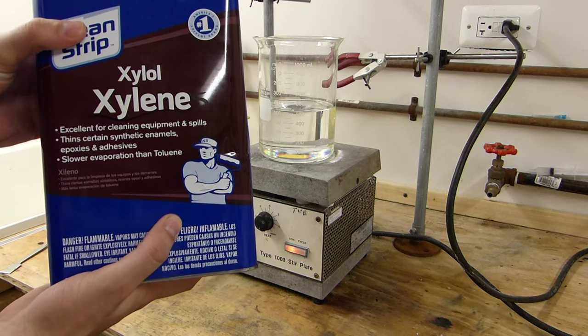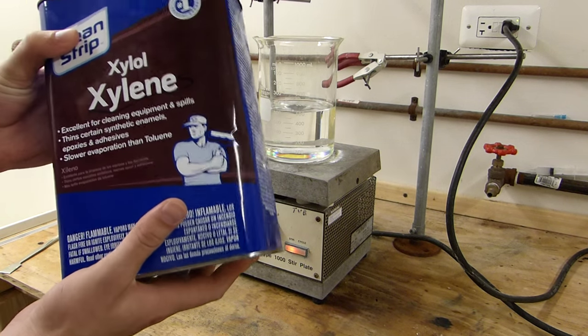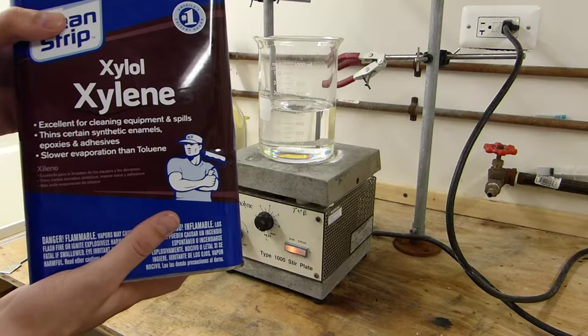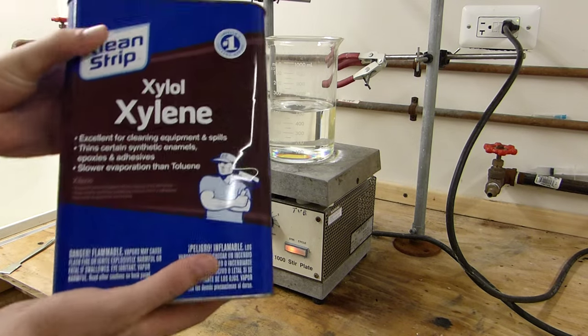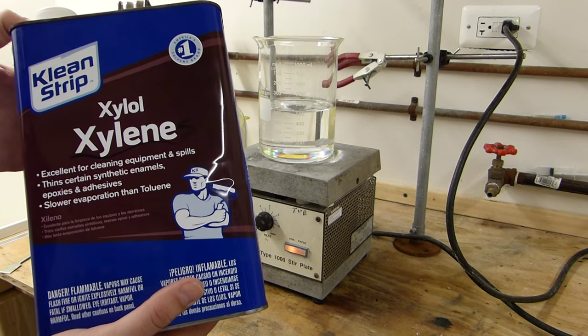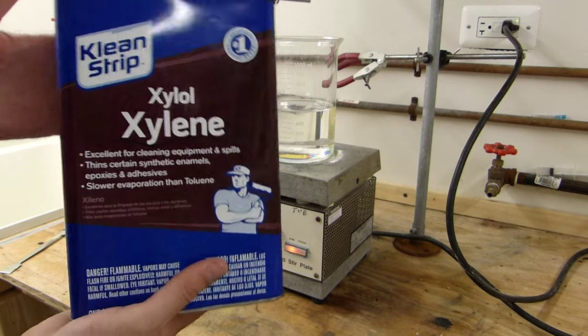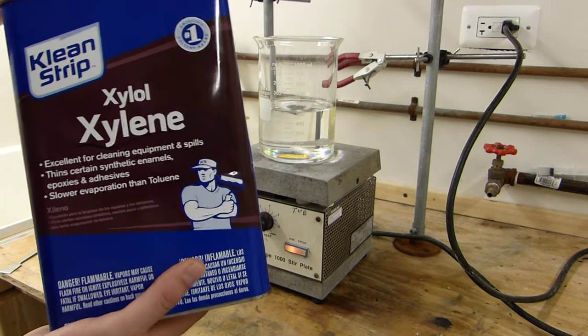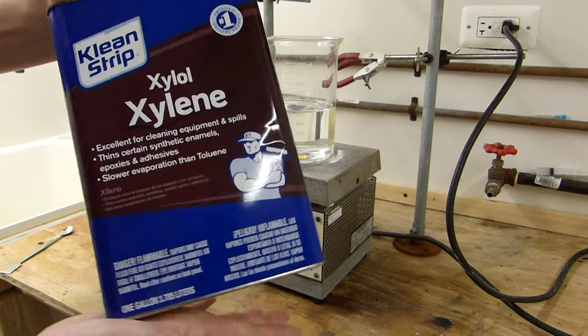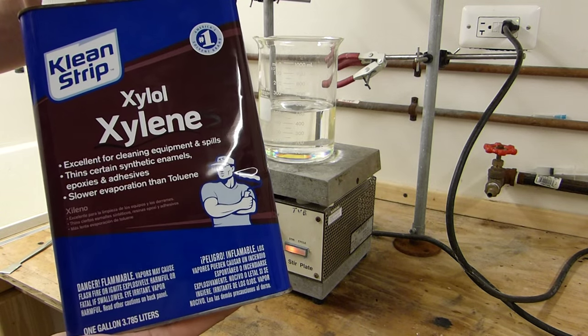This probably also has an ethylbenzene impurity in it as well because they're difficult to separate by distillation, and this is separated from BTX basically in the petroleum industry by distillation. So I expect there to be a small impurity of that in there too, but that doesn't really matter for the purposes that I'm using it for today.